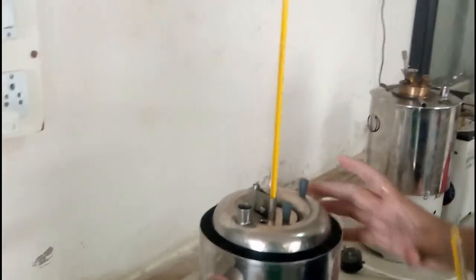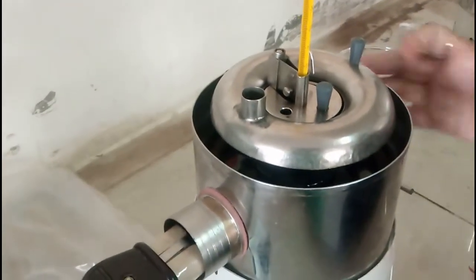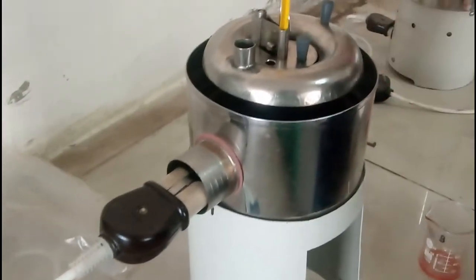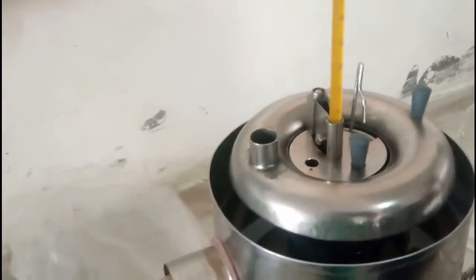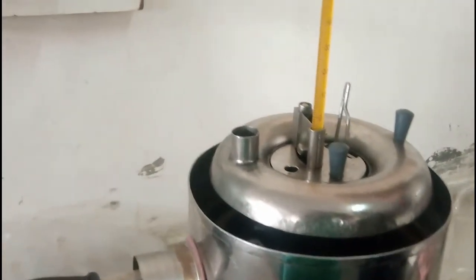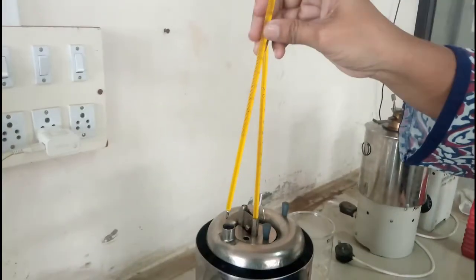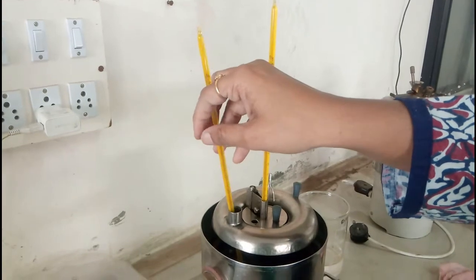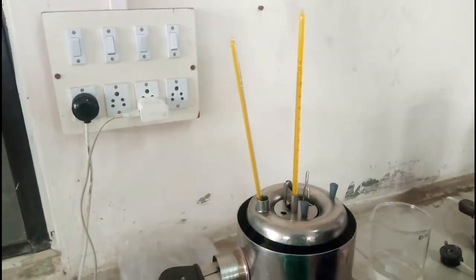I have assembled this Redwood Viscometer. This viscometer consists of two cups — the outer side consists of water. We have taken the water and it is going to be warmed. The inner cup, which I have shown you, has a jet in the center with a small hole. The hole is closed with a ball. I am going to put it on and increase the temperature.